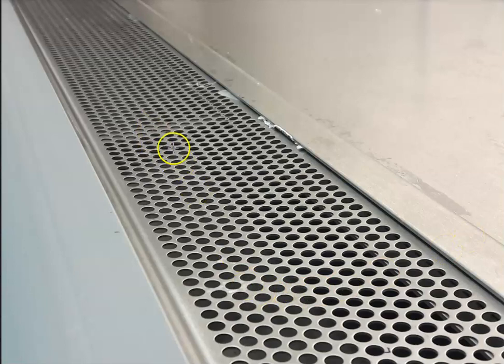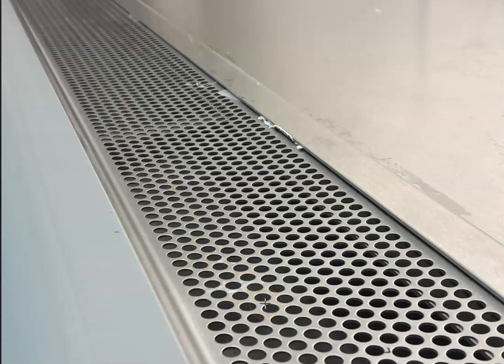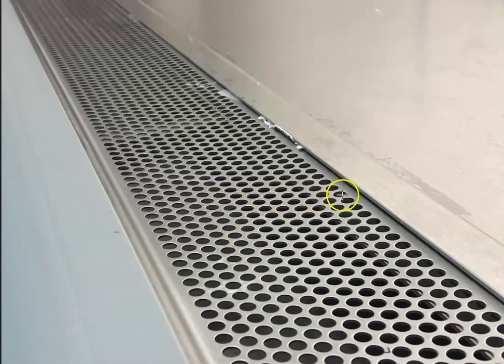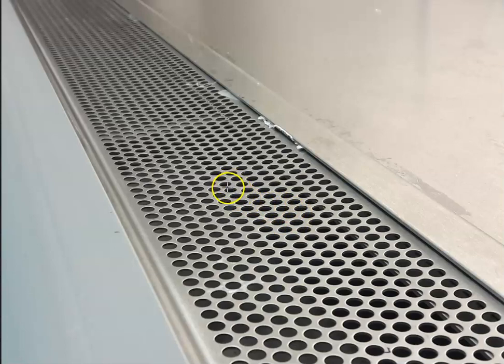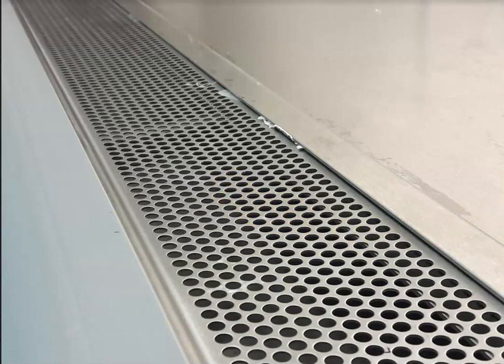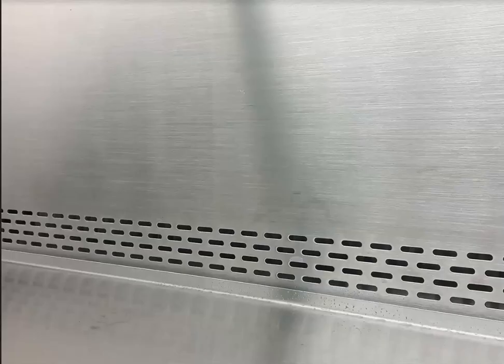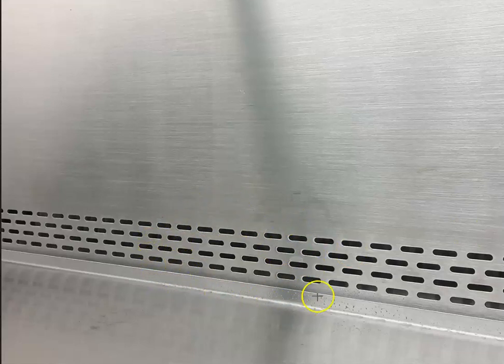This is the front grill mentioned earlier, located at the edge of the cabinet. This is an area in which you should not operate any machinery, and it should not be blocked with any kind of equipment, in order to protect you from exposure to the biological agent. The second grill is located at the rear wall of the cabinet and should not be blocked under any circumstances, as it will disrupt the directional airflow and increase the risk of exposure to the biological agent.